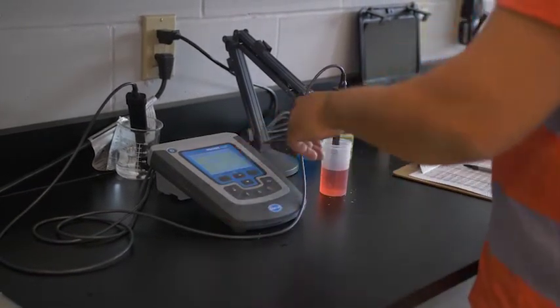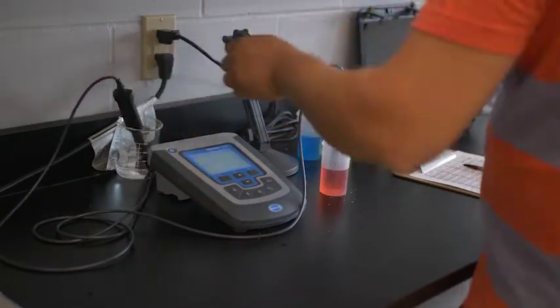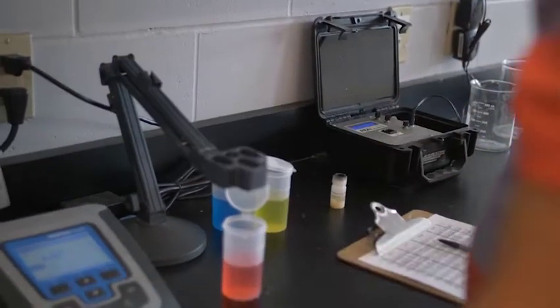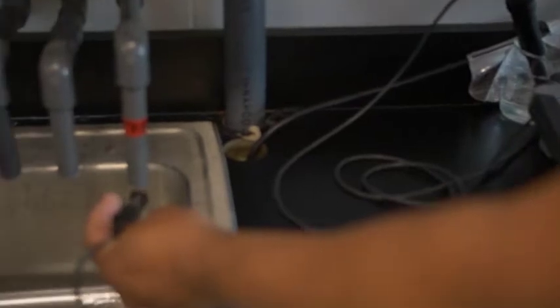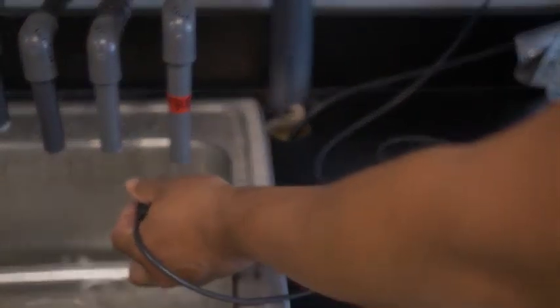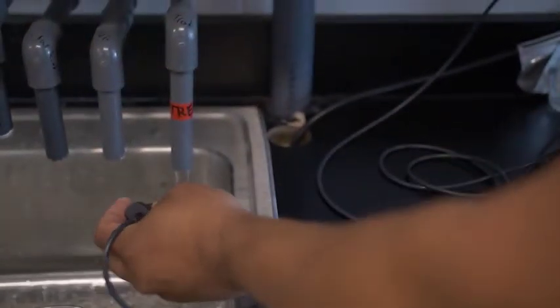This unit actually does pH and conductivity with this probe here. Typically we don't calibrate the conductivity probe daily.